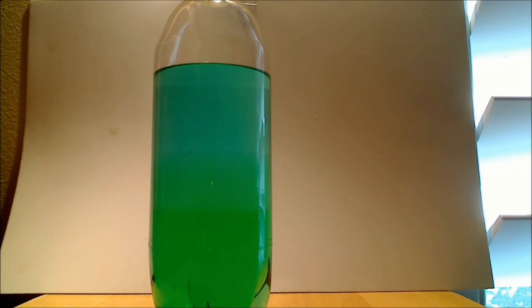And the yellow maybe for the bottom phase. But there's enough blue in the bottom to give it a green color. So we can see a clear separation of the two phases.